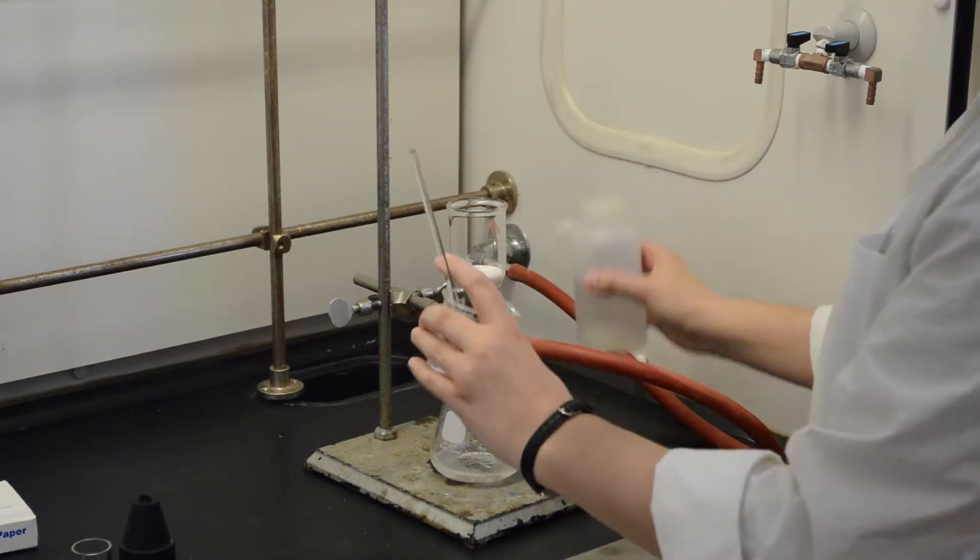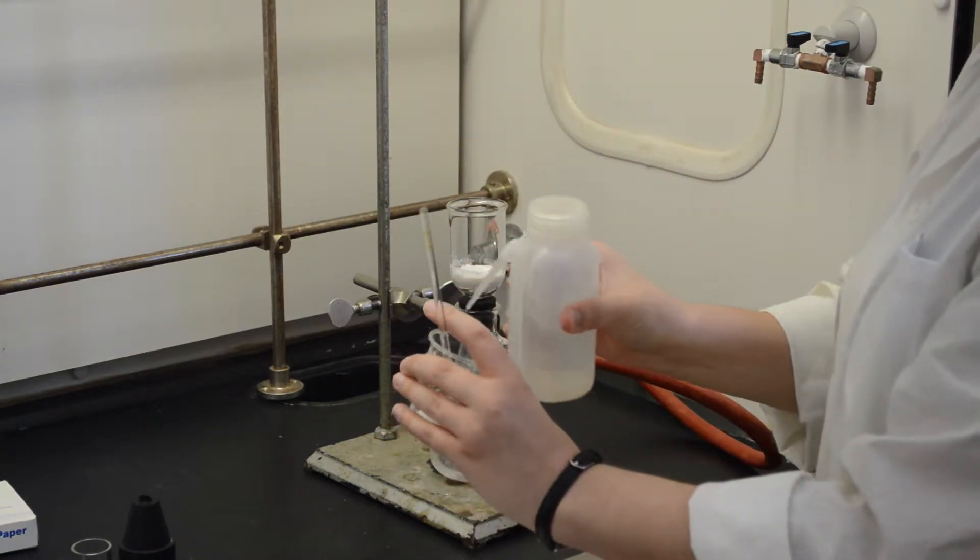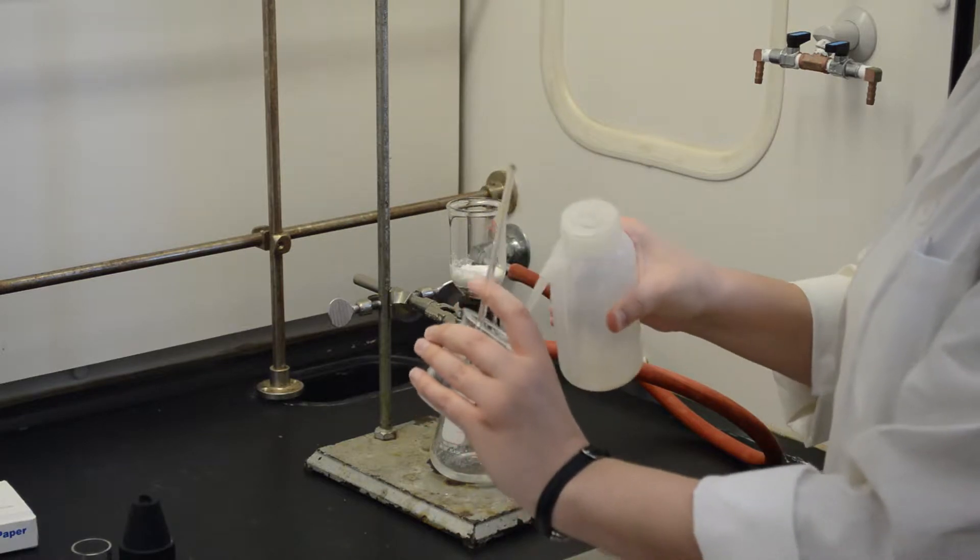It will likely be necessary to rinse out your beaker several times to ensure all of your solid has made it to the funnel.